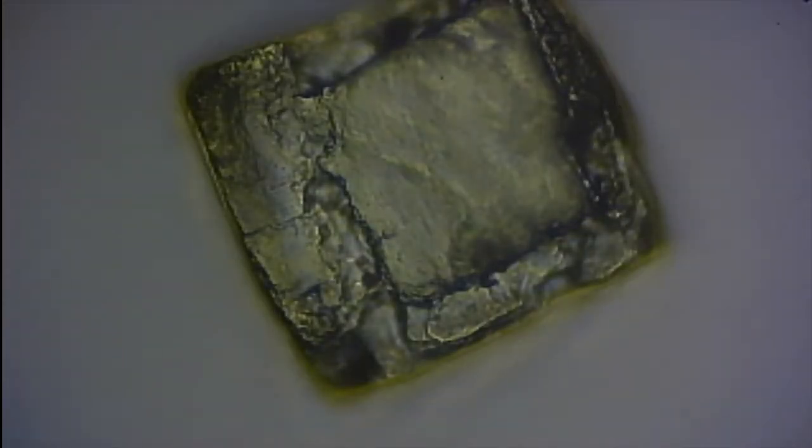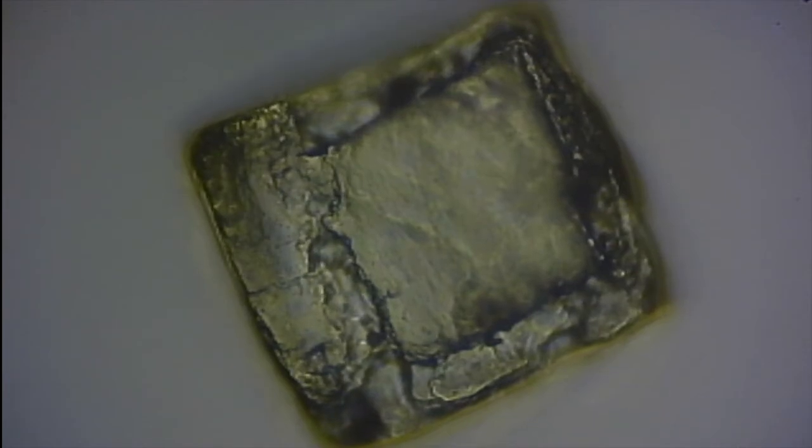Anyway, so medium power setting. I'm babbling. This video is going to go way over time again. And this is actually dark field. Changing the condenser focus, I get this, which is more like classic microscope. Very high contrast. You notice that? It's beautiful, isn't it? Oh my god, it's like looking at a chunk of marble. But that is ordinary table salt right there.